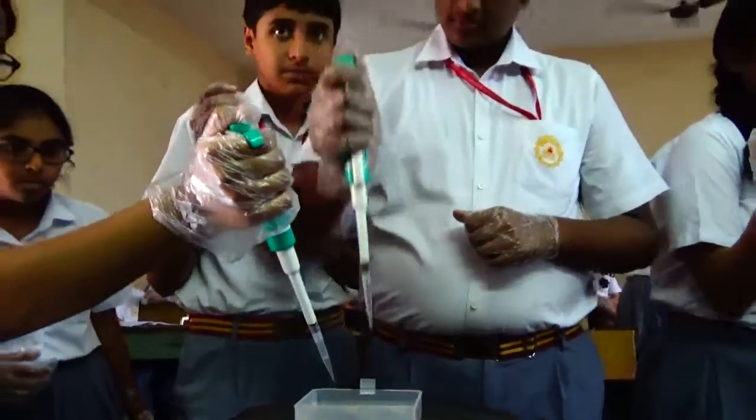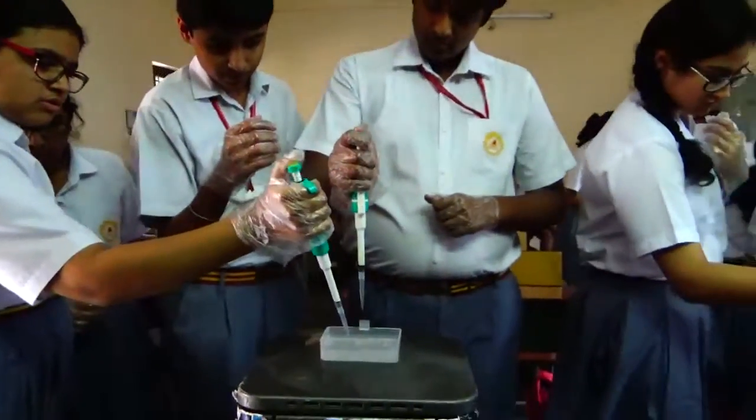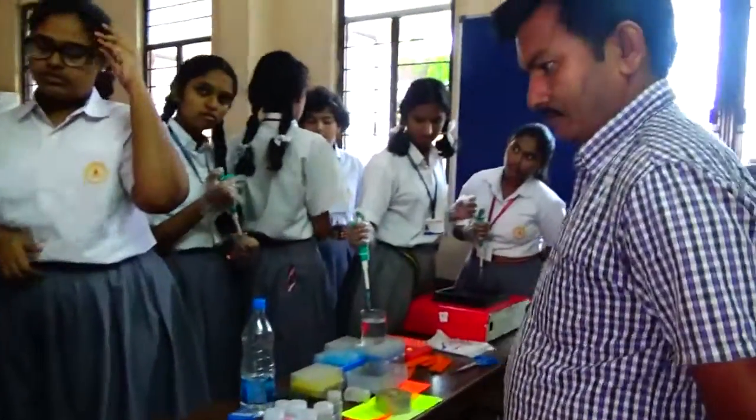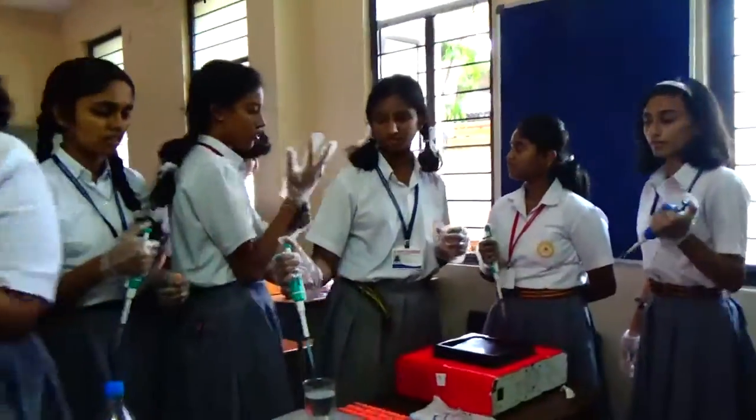Remove it twice and thrice. Come one by one. Share the pipette. Come one by one and try it.